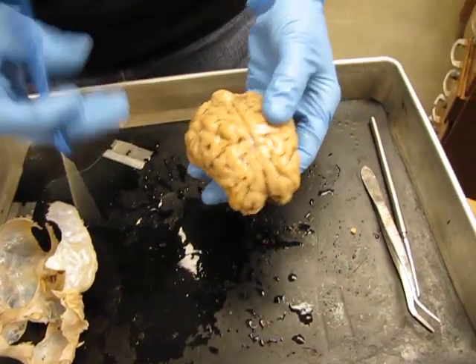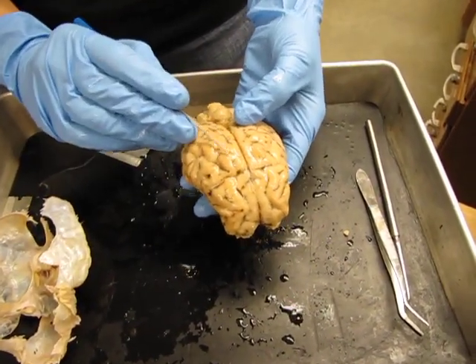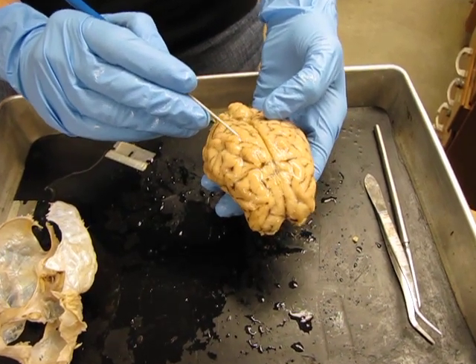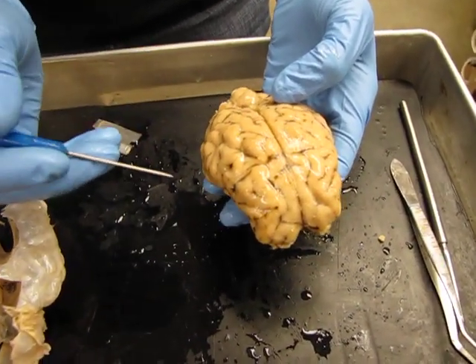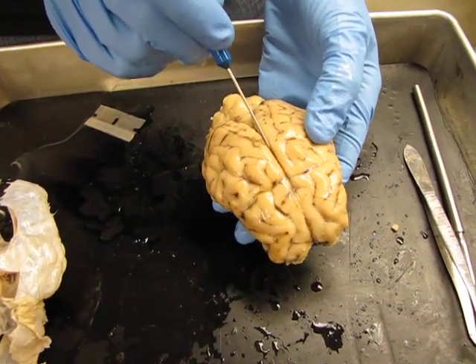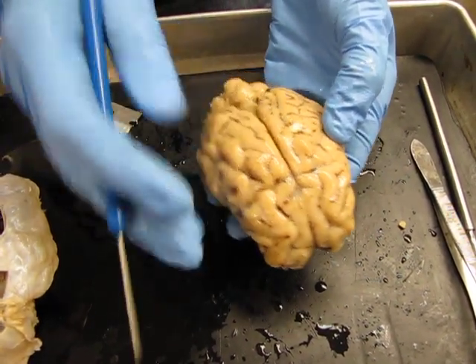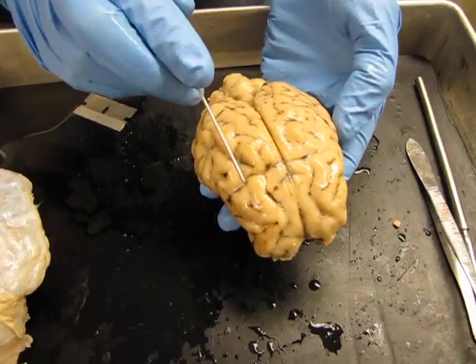With the dura removed, now you can start to see the ridges and the bumps of the sheep brain. The ridges and bumps are the sulci and the gyri, and the longitudinal fissure is this deep fissure that goes between the two sides, separating the left and right hemispheres.